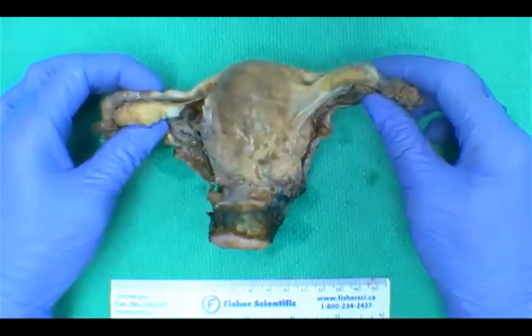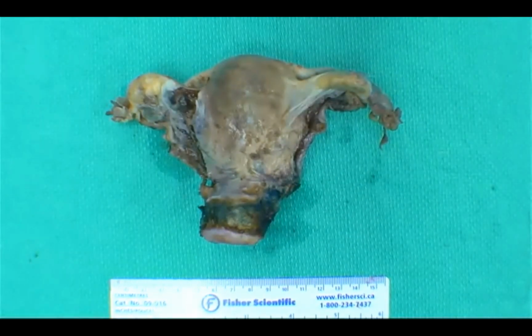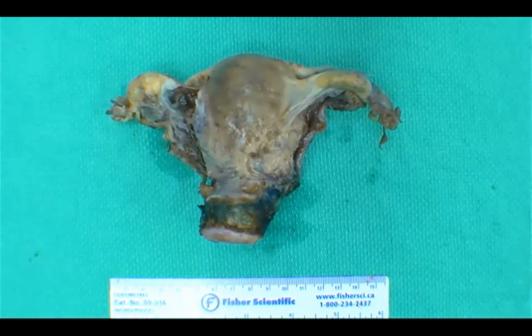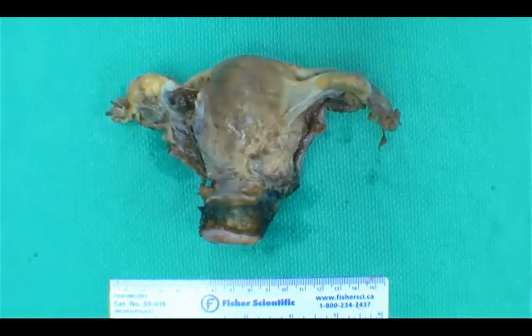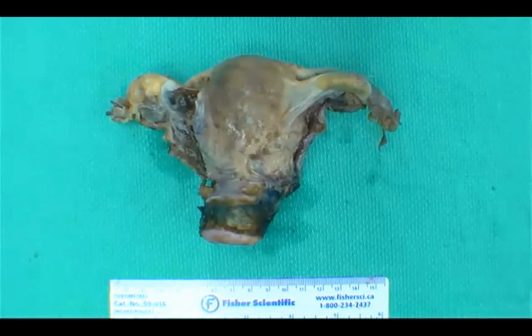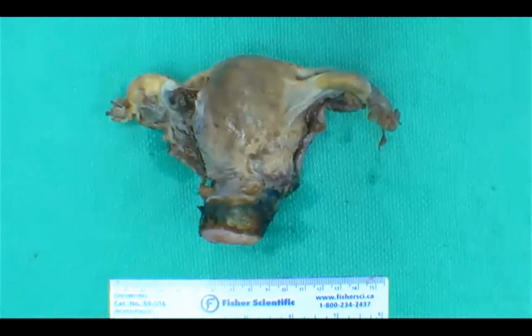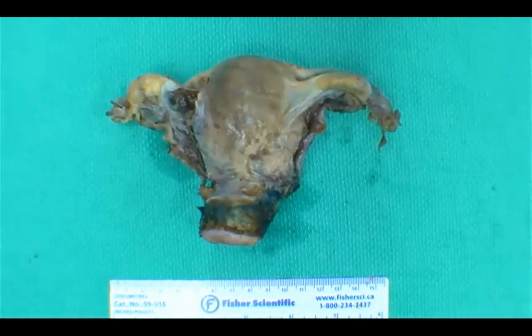Often when you have a hyst with the cervix, you usually have a very shiny thing. But again, there's a disconnect here, right? Because as everyone pointed out from the chat, for a cervix CA, you usually have a rad hyst, which means a lot more parametria and vaginal cuff that's removed. So we will proceed along those lines of the discussion. And I think we can go into maybe our second question.